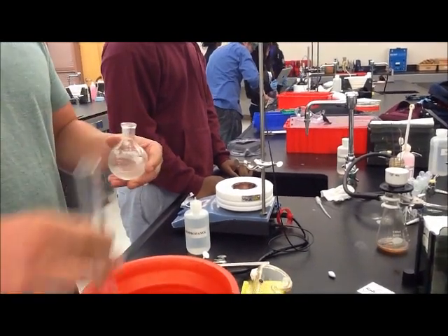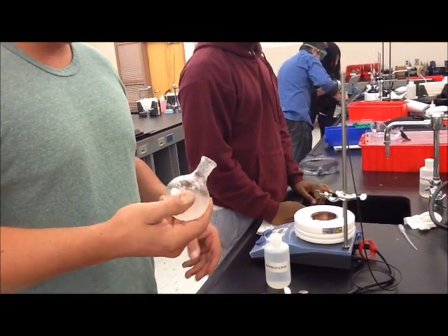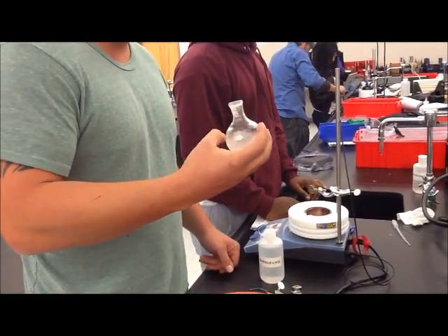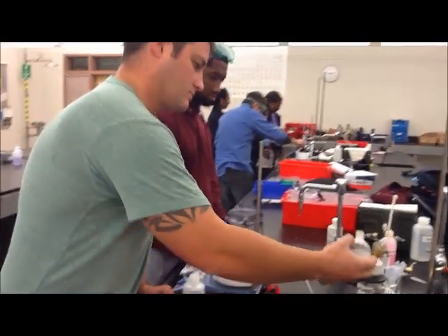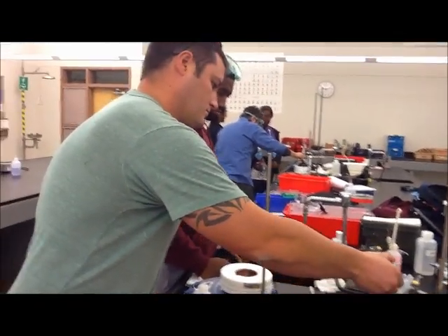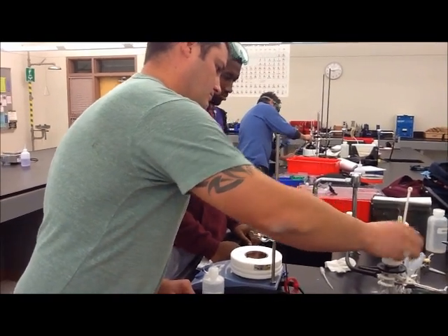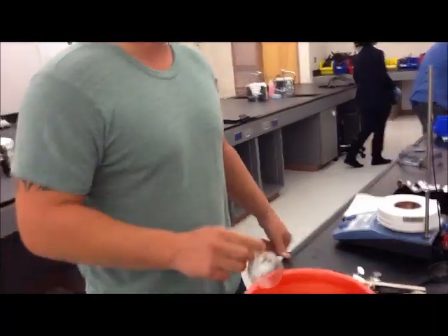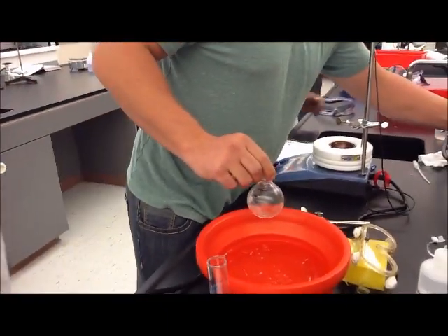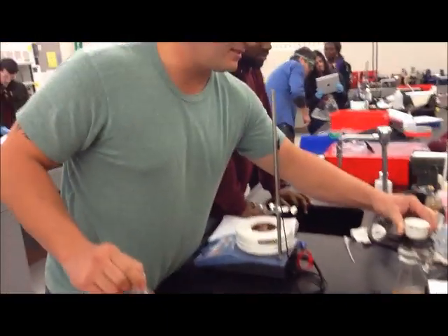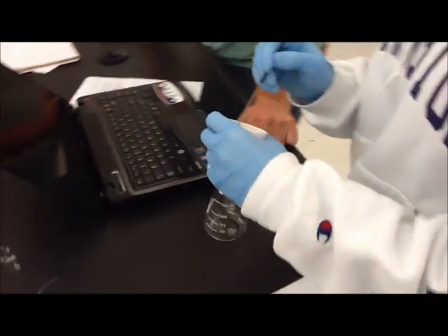Wow, we have a nice yield. I really hope so. This is a really high yield, guys. Awesome.